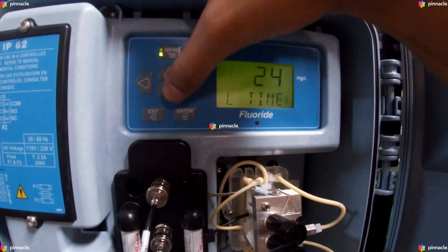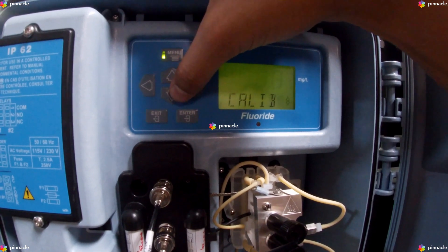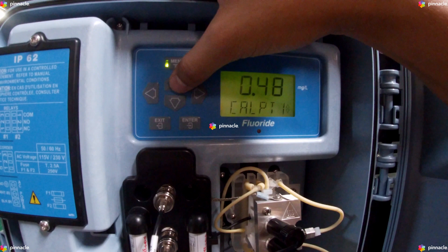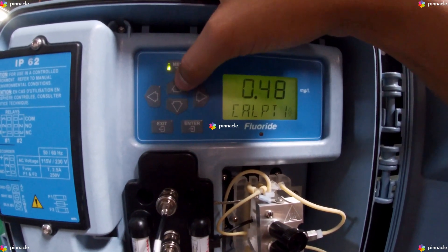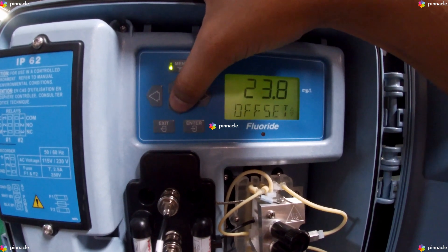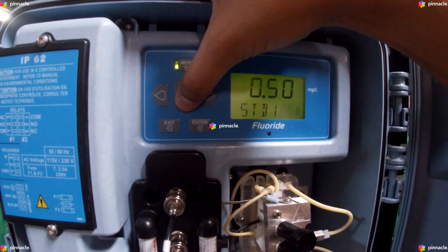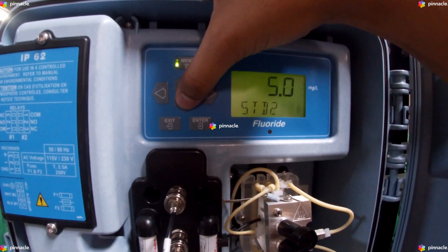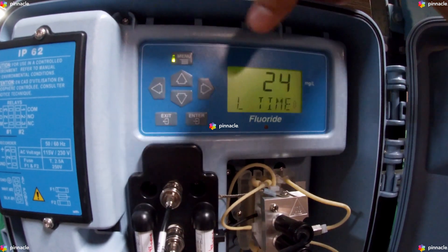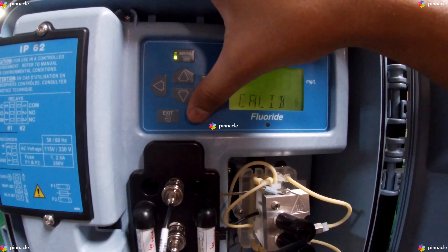We will go ahead and scroll through the menu. We have Calibration, CalPart1, CalPart2, Offset, Slope, Standard1, Standard2, Default Cal, CalTime, and Calibration. Press Enter.